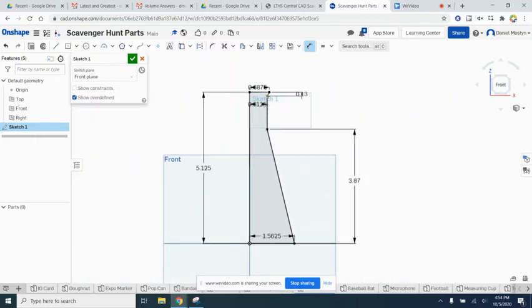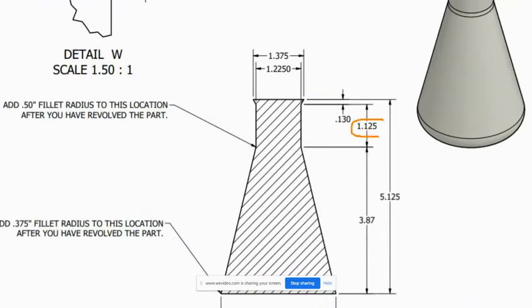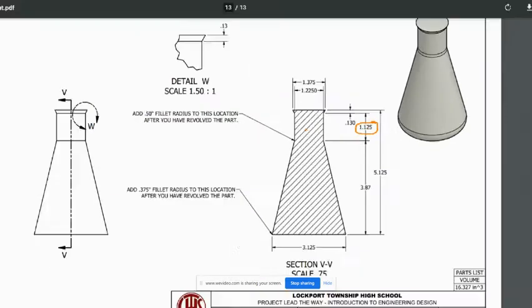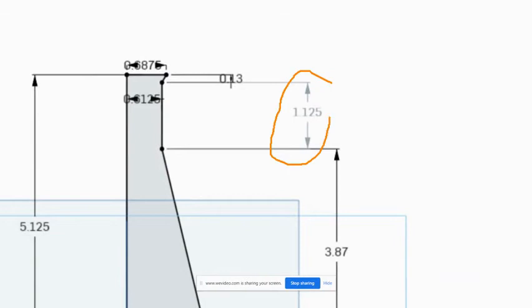What else do we need here? I think we need the length from here to here. I think that's another dimension that we need. So we'll check that out. It looks like it's 1.125. And that's what popped up. So if I hit enter, it turns this gray color. That means that it's already defined. We put enough dimensions in that Onshape could figure out that this dimension exists.